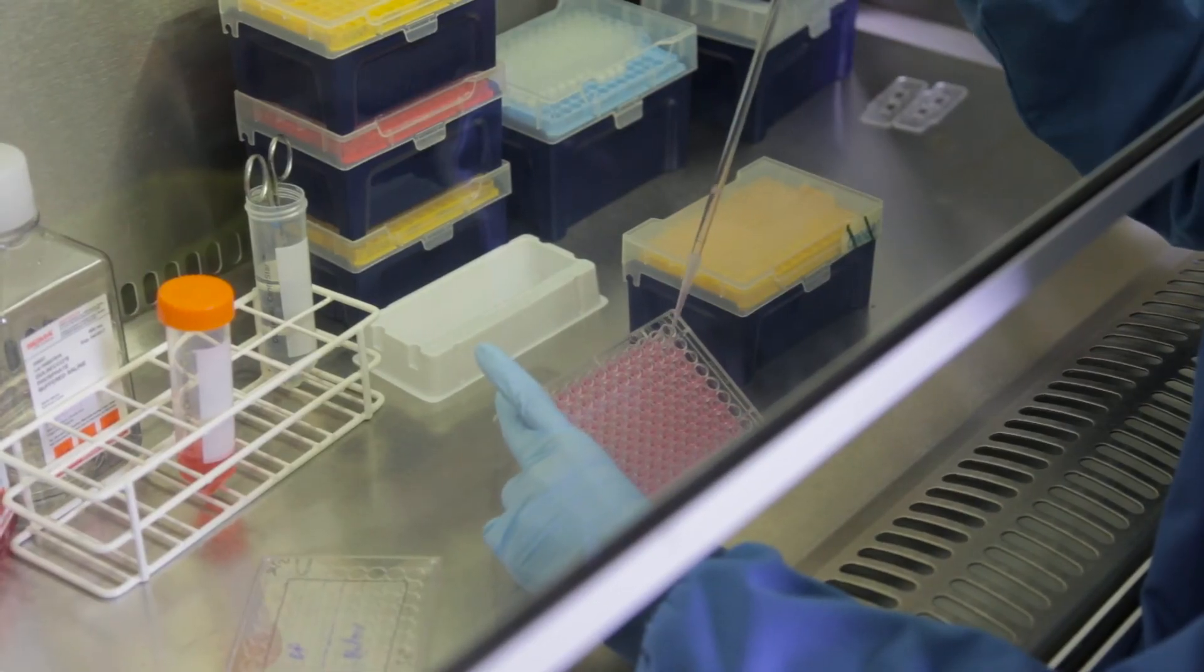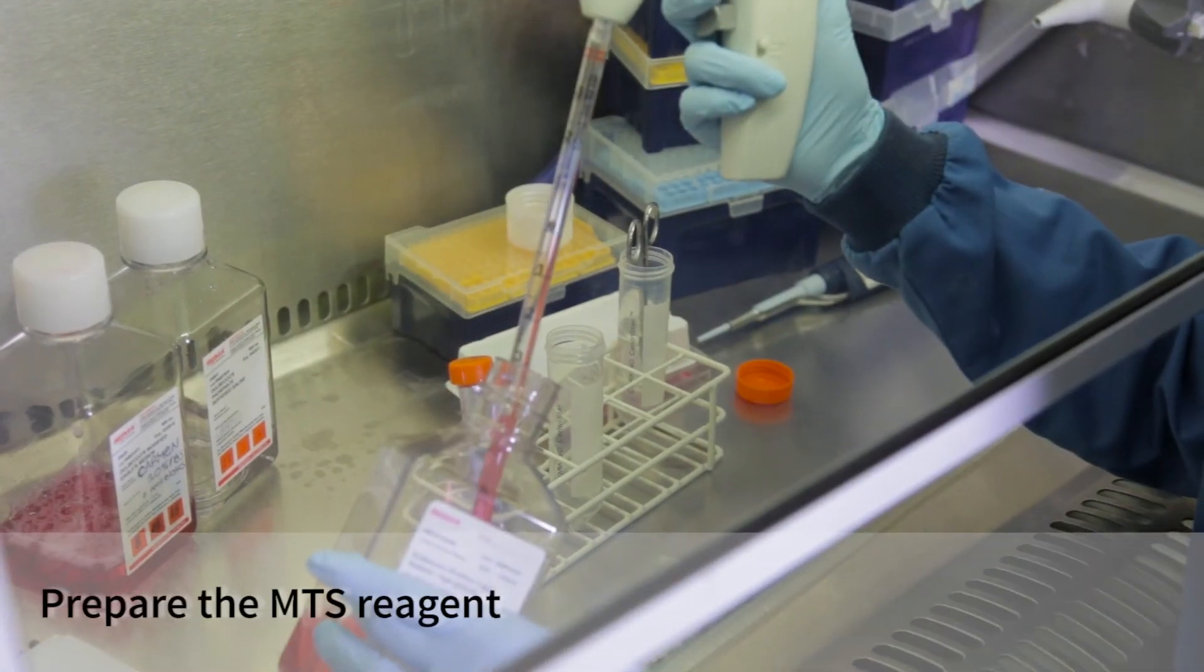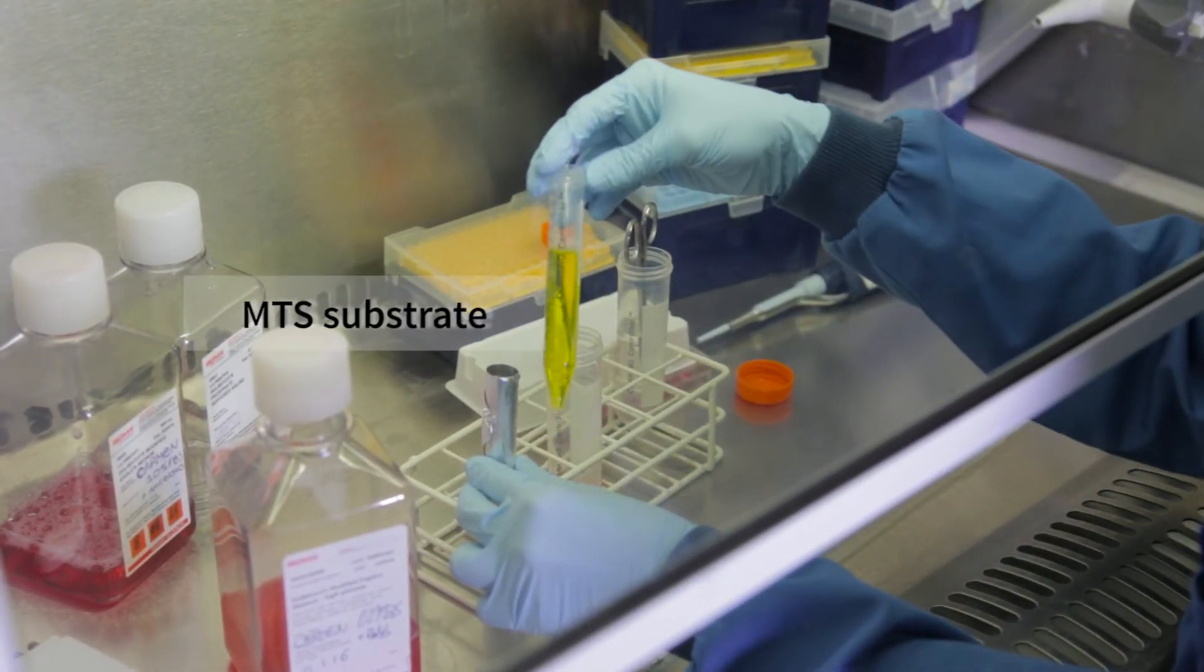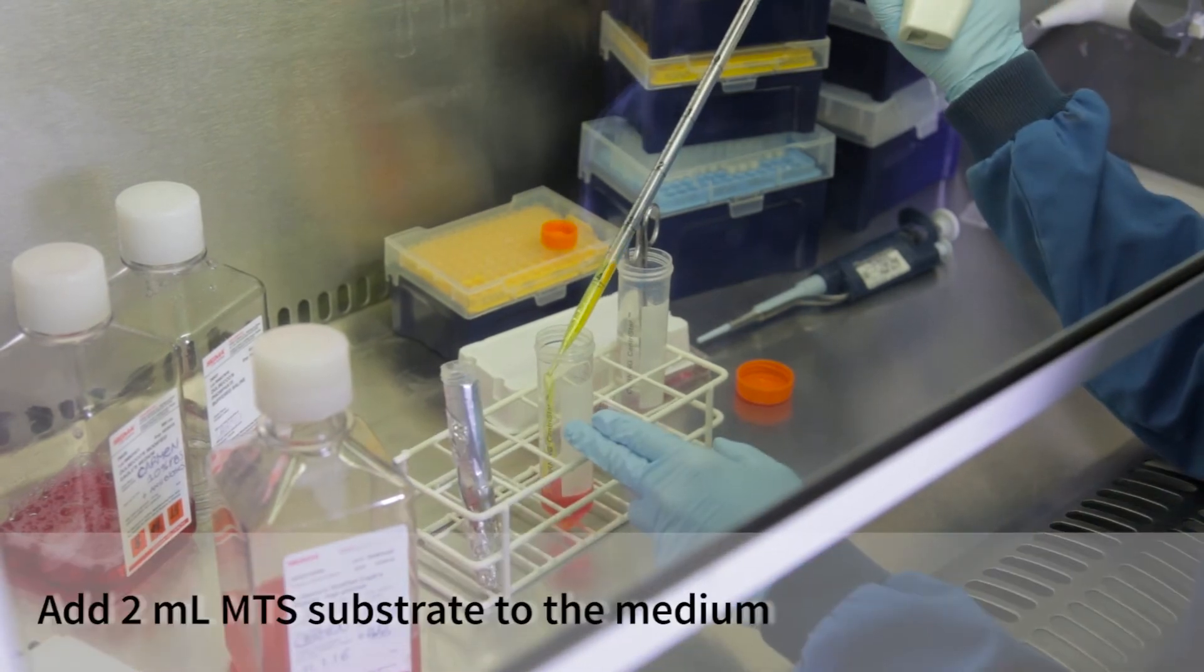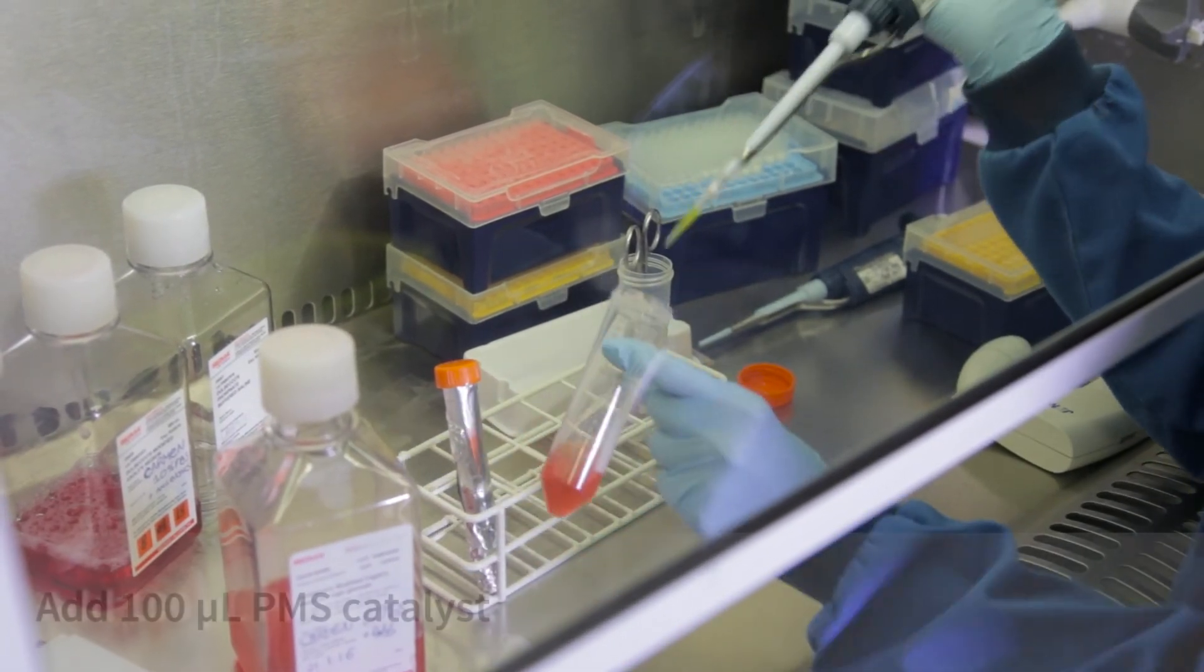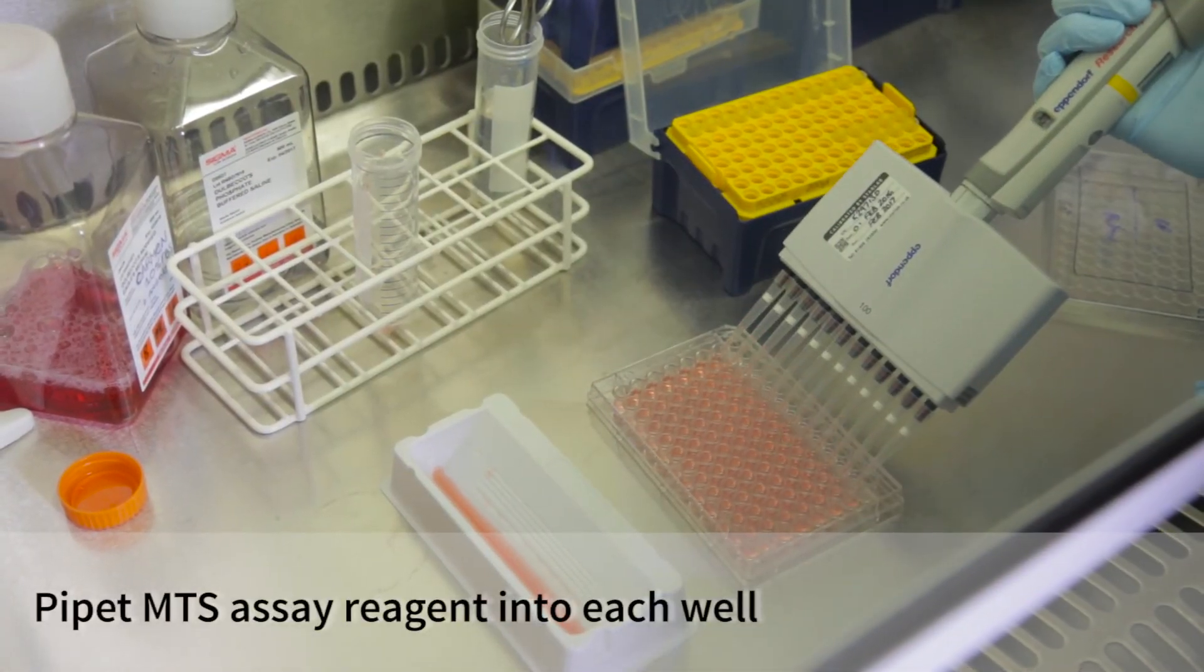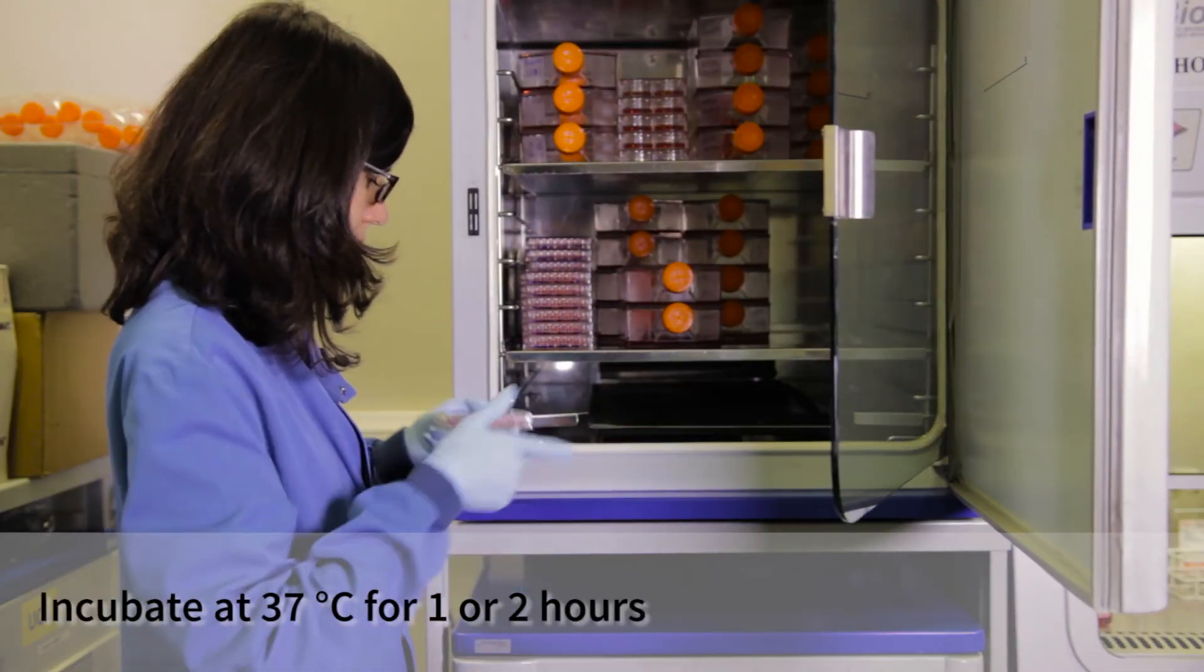Before adding the MTS to the plate, I have to discard the media. I do that by aspiration. I add the prepared MTS reagent to the cells seeded in 96-well plate by using a multi-channel pipette, as before. I will now incubate the cells at 37 degrees for one or two hours, depending on the cell line.